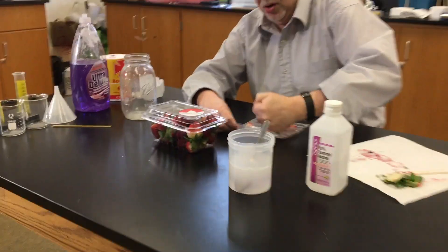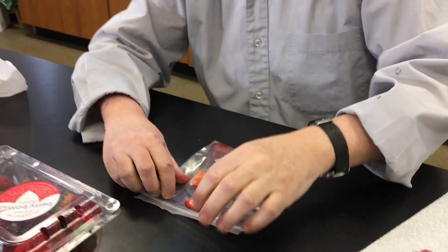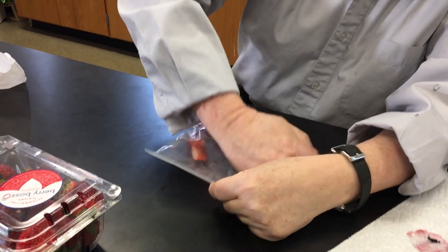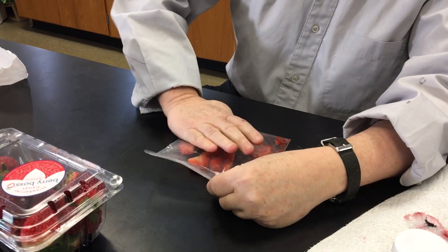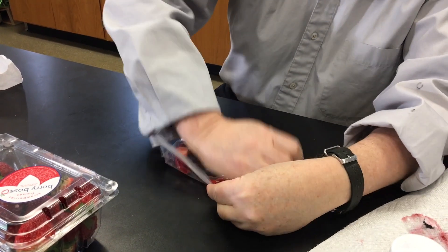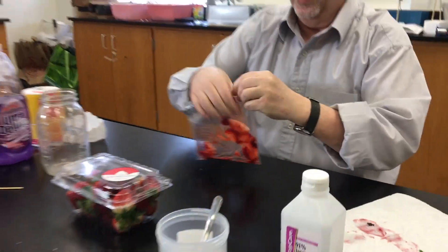Strawberry goo. You don't want any big pieces. This may take a while.